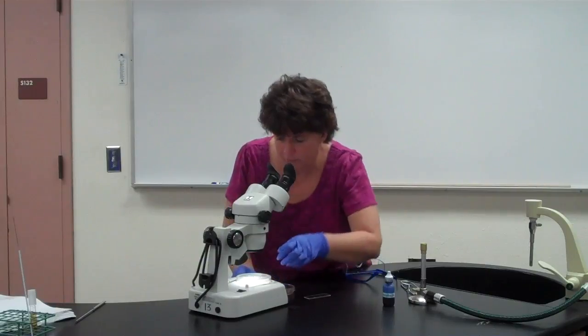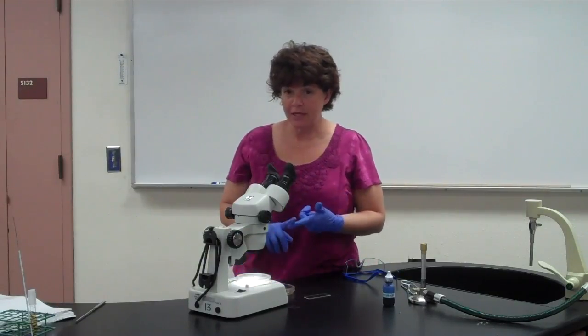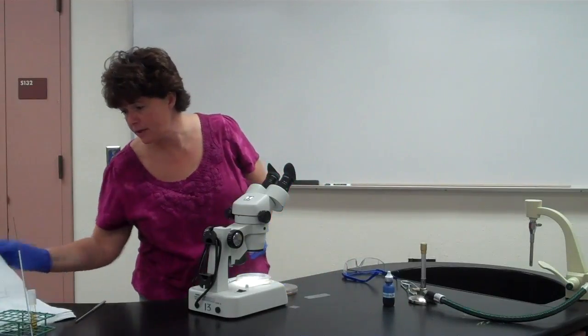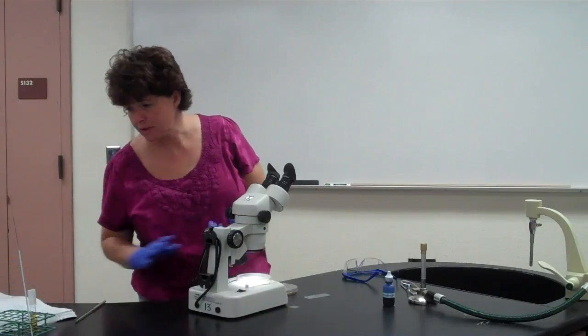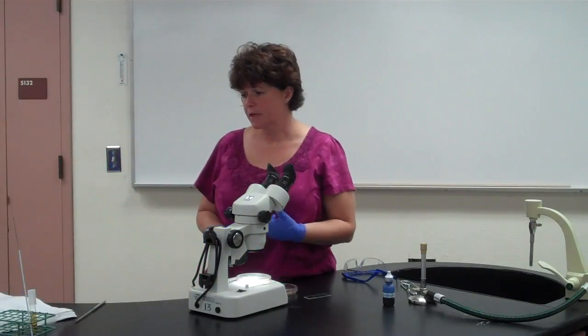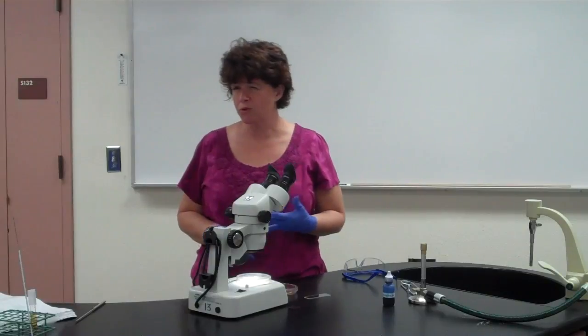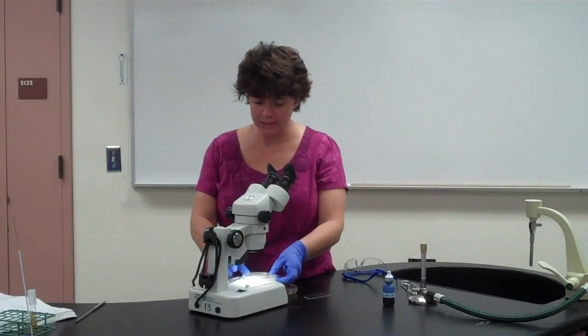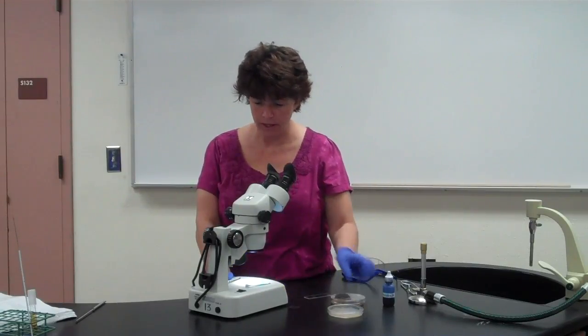And once again, you're looking to see if you can see hyphae, if they're aerial hyphae, if they're vegetative hyphae, you're looking for spores and things like that. You'll notice in the key here in the manual, they talk about the color of the colony, the color of the spores. With molds, you'll see a fuzzy appearance to them. So that's what you're looking for with the hand lens. Once again, this is what you're going to do the second period after yours has grown. Okay?